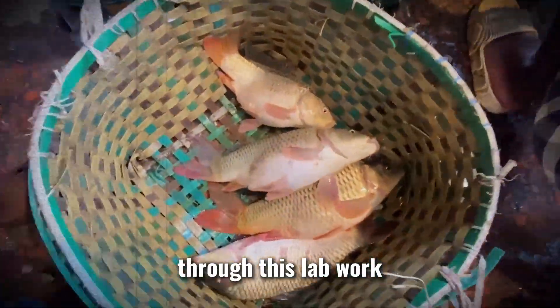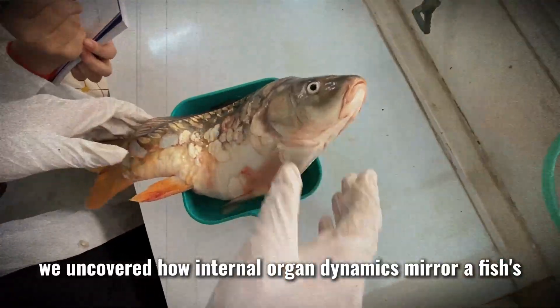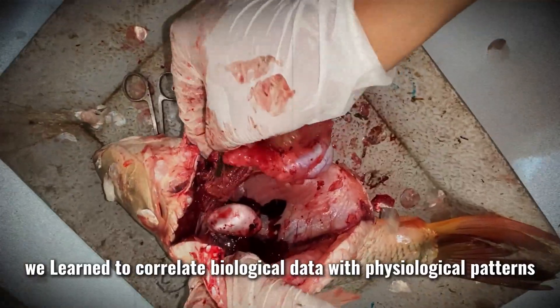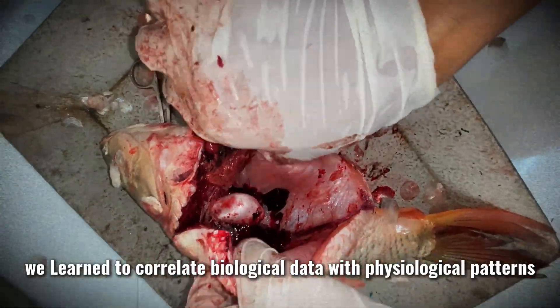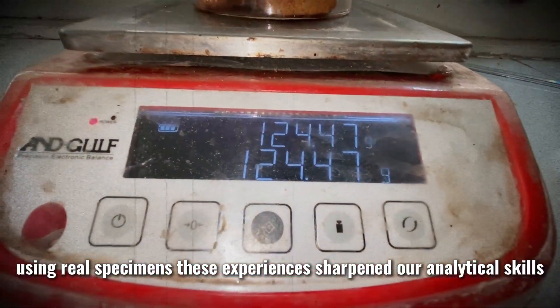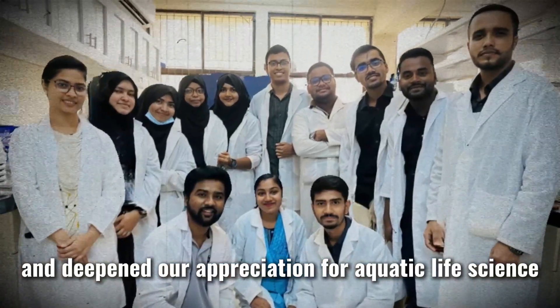Through this lab work, we uncovered how internal organ dynamics mirror a fish's reproductive journey. We learned to correlate biological data with physiological patterns using real specimens. This experience sharpened our analytical skills and deepened our appreciation for aquatic life science.